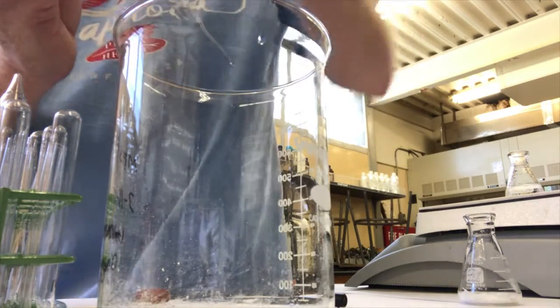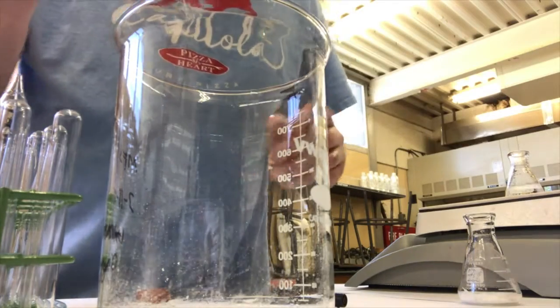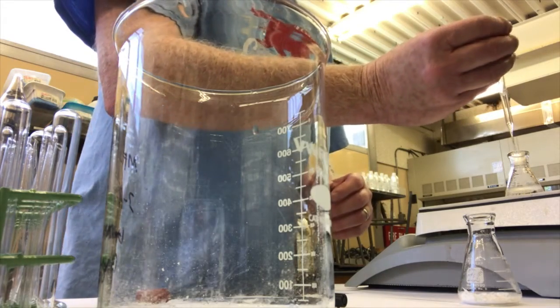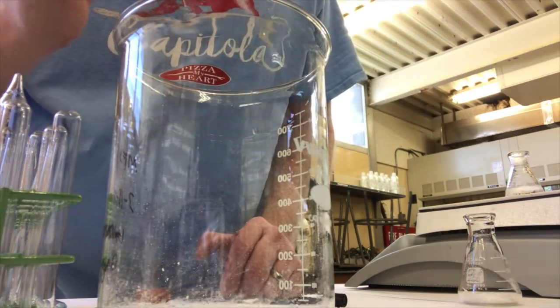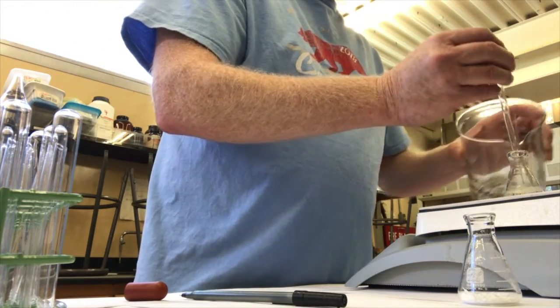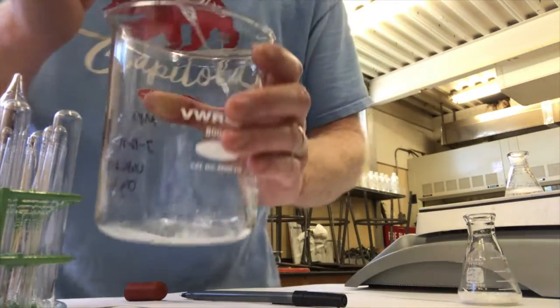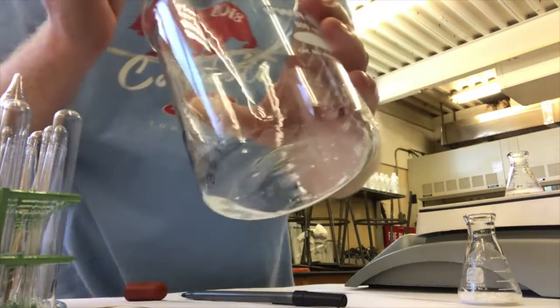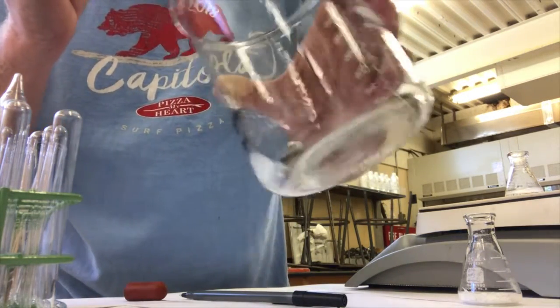My first aliquot, maybe, of boiling methanol. Oh, that shot on me. I rushed it. You guys can see me well on the camera. I should have my beaker over here. So I'm going to add some more. Try to get all that solid down to the side. I got some down there.